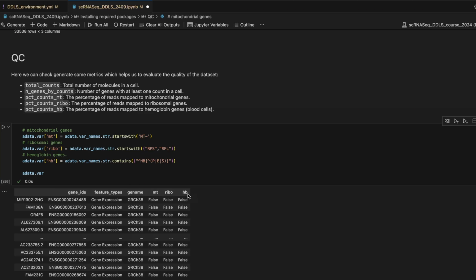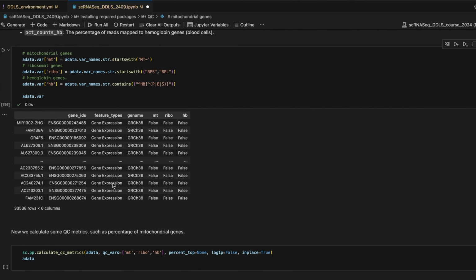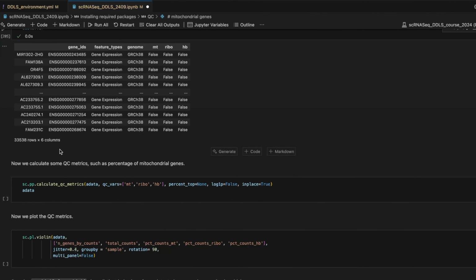So it's just labeling whether a given gene is coming from the mitochondrial genome, for example, or is labeled as ribosomal or hemoglobin. These are the regular expressions that you can use. I'm not going to dive into that. But anyway, now that we have these, we can use Scanpy to calculate the metrics.